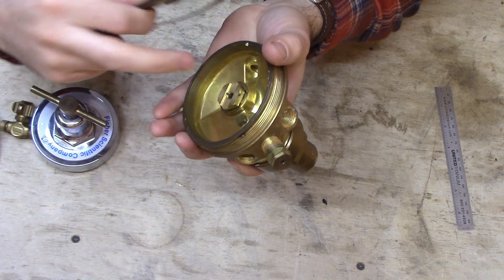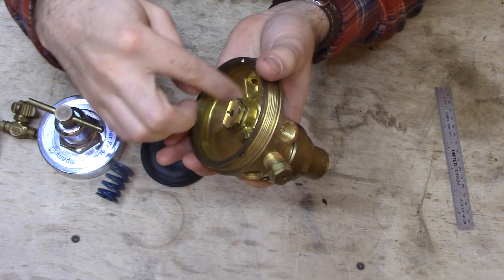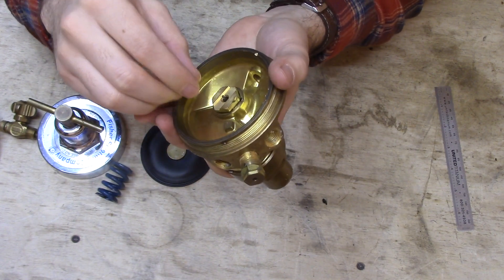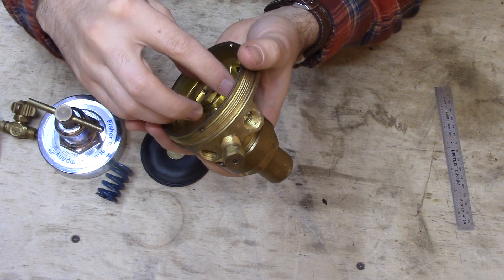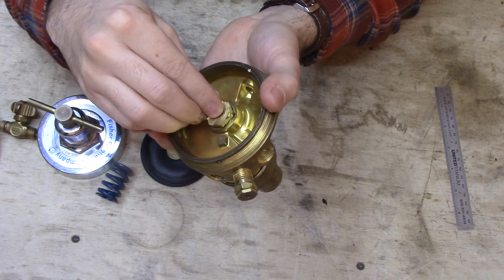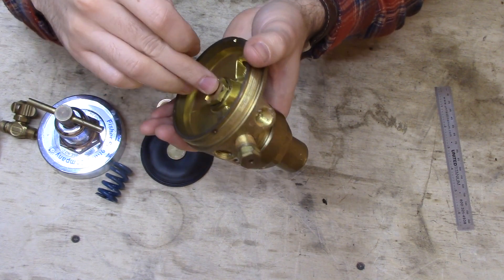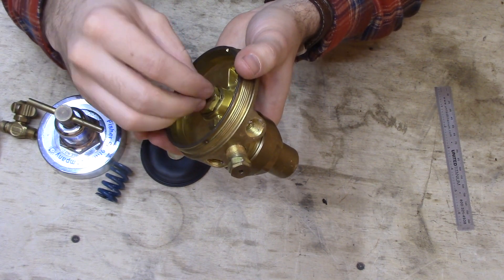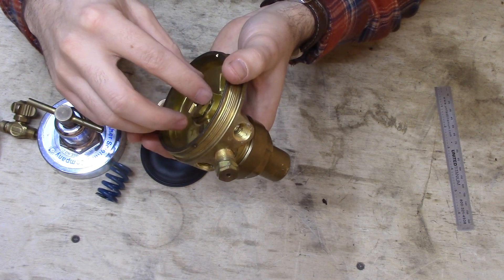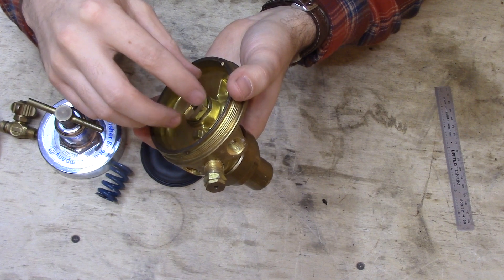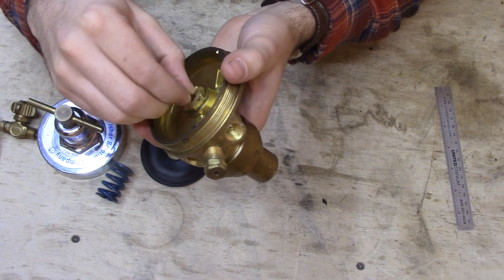Inside of here is actually a valve that lets air into this chamber. So when the air in here is at too low of a pressure, lower than the set point, this valve is pushed in, which means it's open, and it lets gas molecules come into here. At some point they build up enough pressure, they push out the diaphragm, and this valve closes.